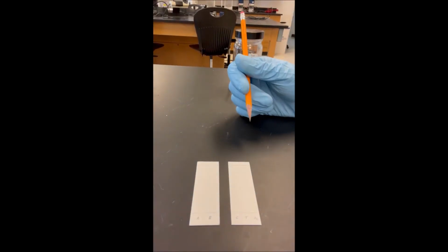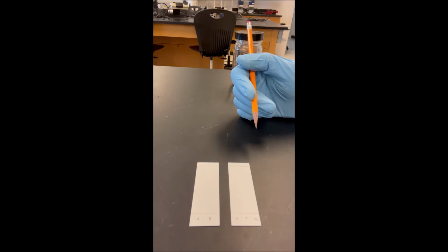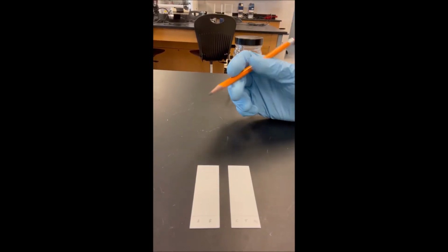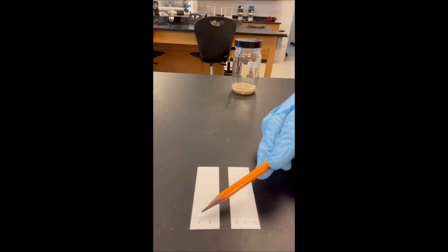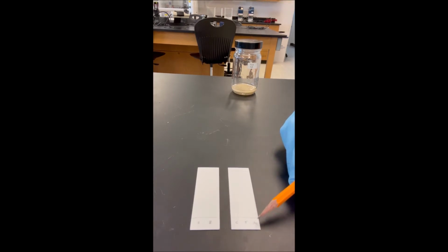Okay guys, so this video shows my two TLC plates, and you can see I've got some stuff written on these. There is the plate on the left that has A and B written on it. This plate is for unknowns A and B. And I'm going to spot A above letter A, I'm going to spot B above letter B. On the other plate, I have spots for C, T, and AS, caffeine, Tylenol, and aspirin.